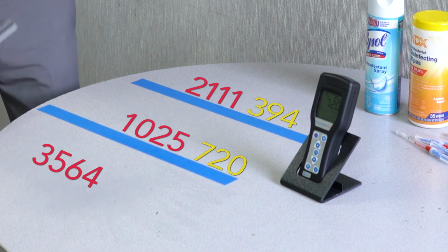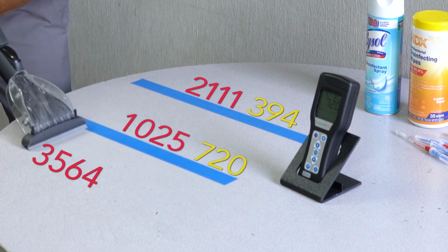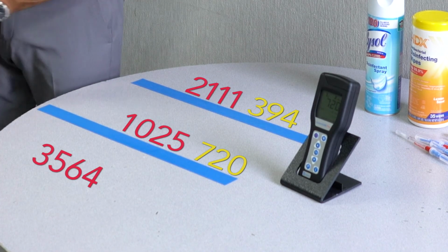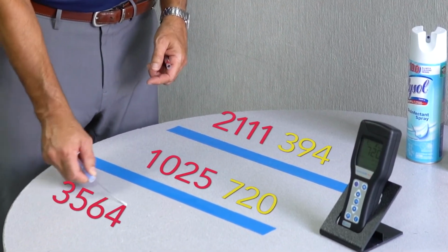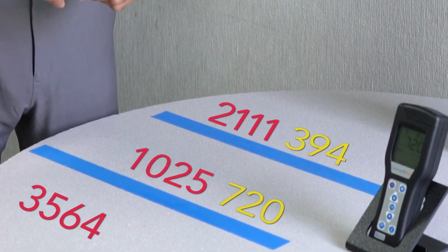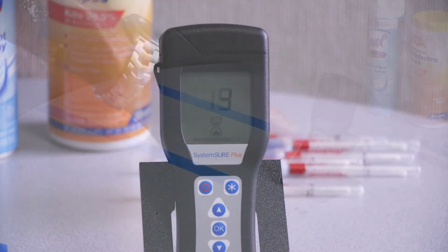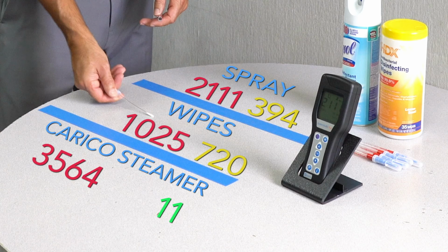So another benefit with the steam is we're going to remove any excess moisture as well. Okay, so now we'll go ahead and test the area I cleaned with the steam. Okay, so if you remember, this section was over 3,500, and now we're down to 11, which is in the safe zone for food preparation.